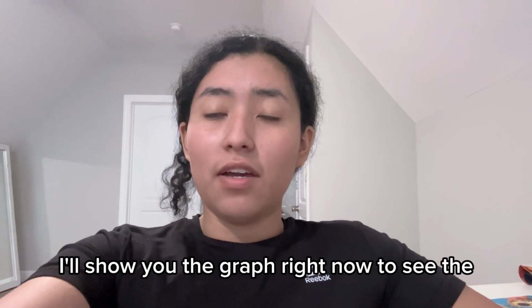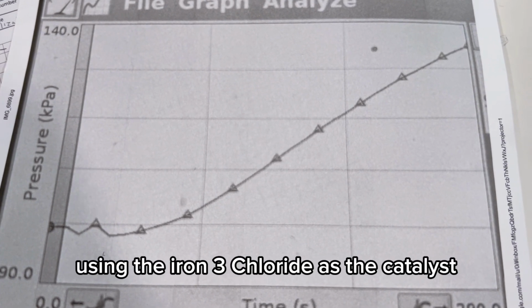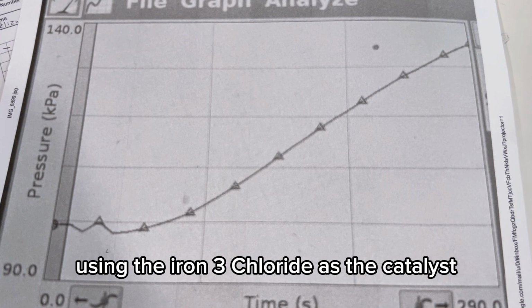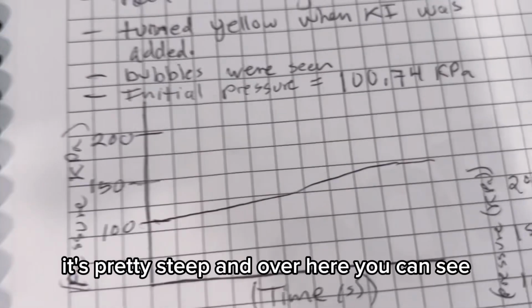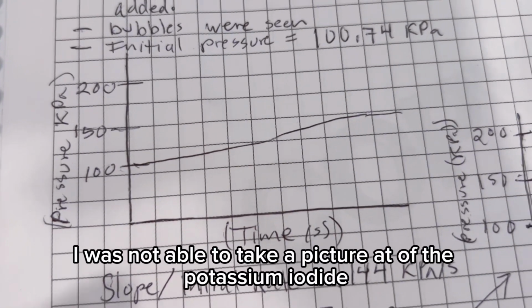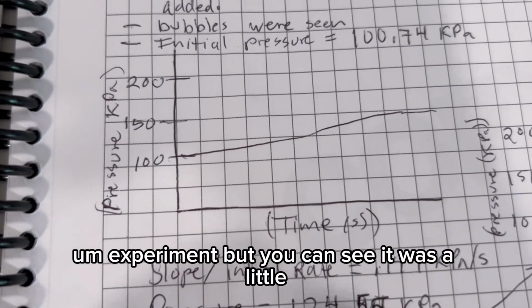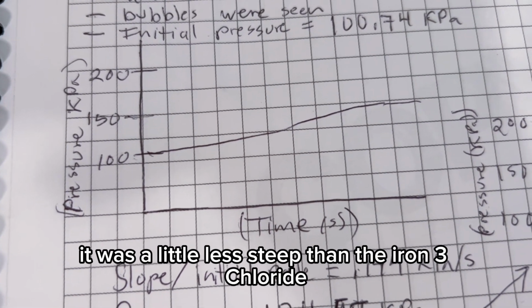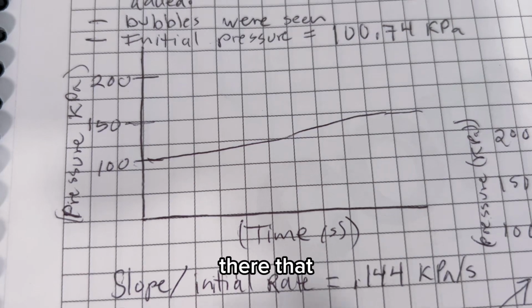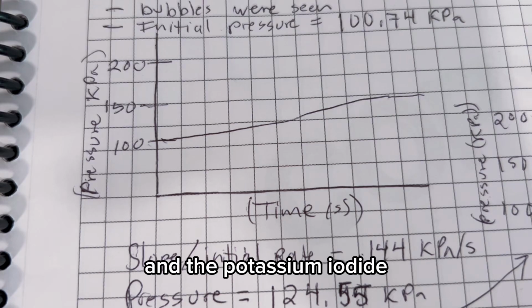I'll show you the graph right now to see the comparisons. You can see here that this is for one of the trials using the iron 3 chloride as the catalyst. It's pretty steep. And over here, I was not able to take a picture of the potassium iodide experiment, but I did notice it was a little less steep than the iron 3 chloride. So you can see through the graph that yes, there's a difference between the iron 3 chloride and the potassium iodide.